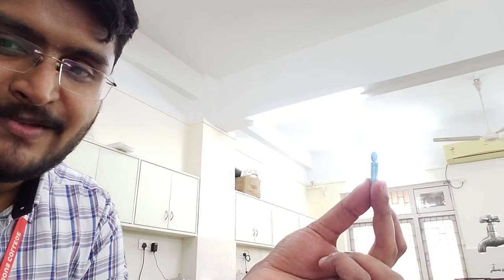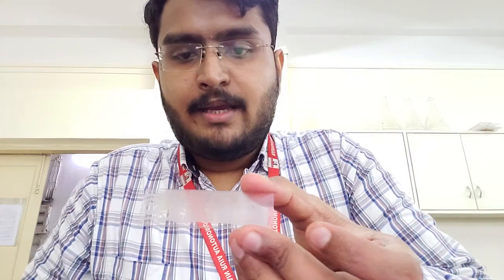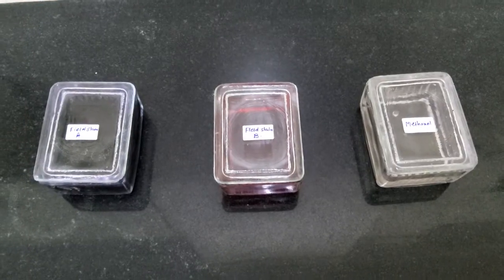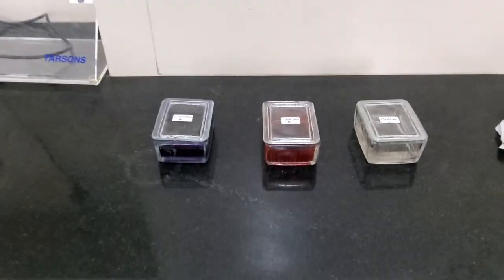You can see that my slide is almost dry. There is no moisture or wetness that I can see, so now I'm ready to start with my staining process. Let's see what are the steps involved in this particular staining process.